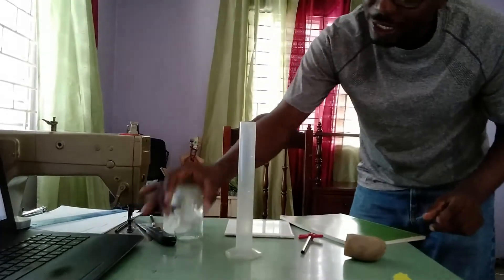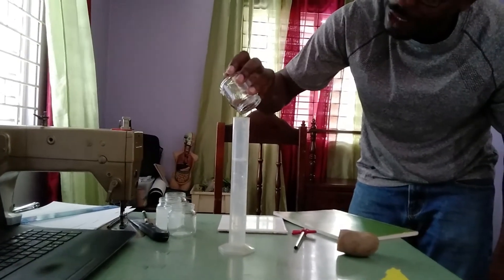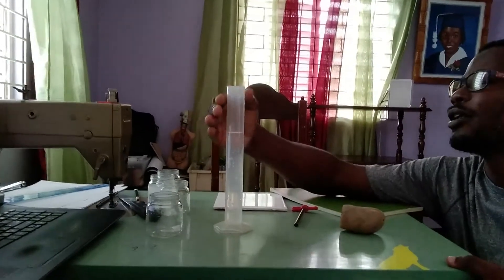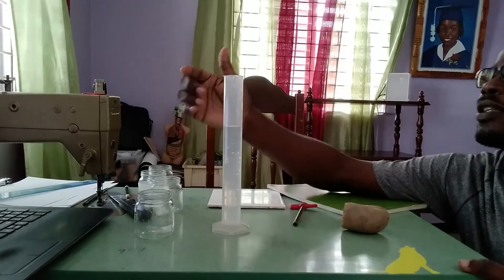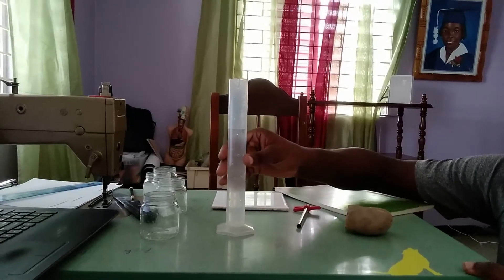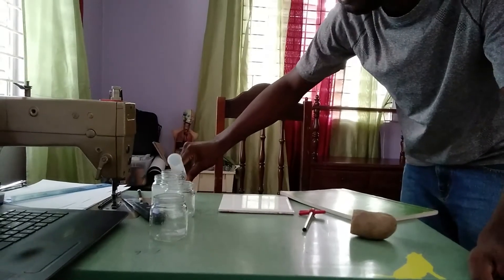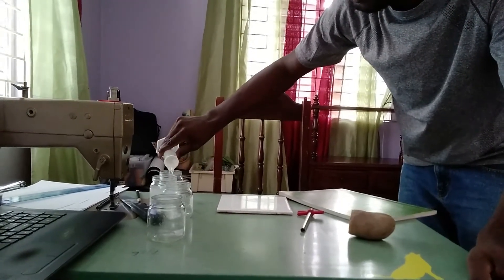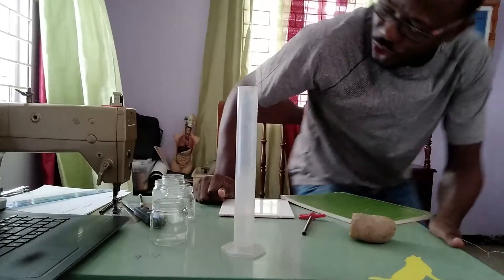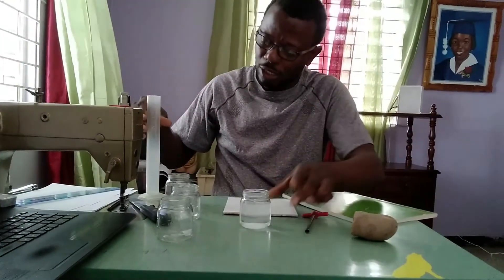We are going to measure another sample of water using the same measuring cylinder — we are using 86 ml of water for both samples. Remember we are looking for the meniscus, that's the curved surface at the top of the water. I like to call it the thickness of the water just below the top there. If you were using oil you would have seen that very easily, but we are using water.